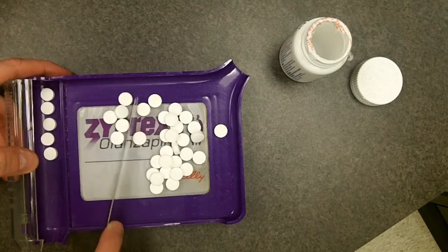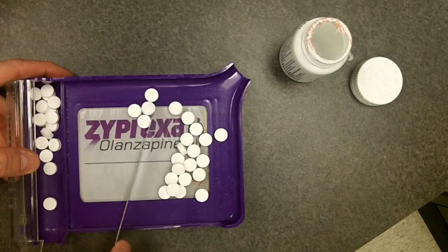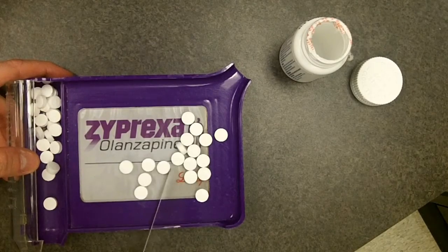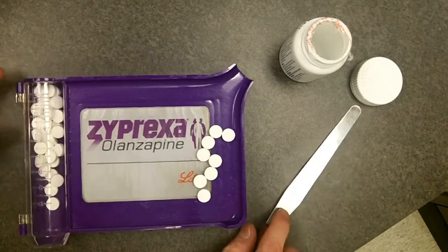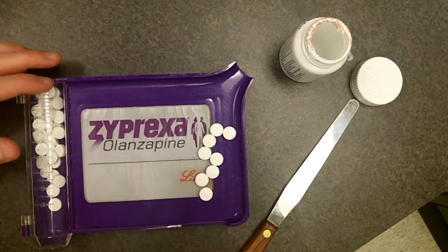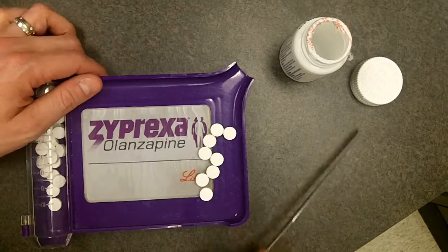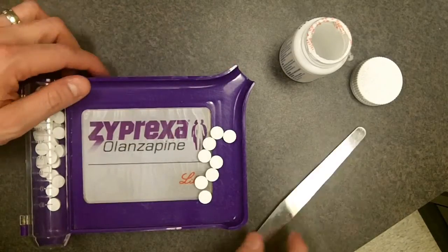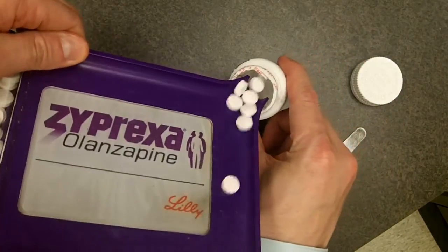Count by fives: 5, 10, 15, 20, 25, 30. Now you have 30 here in this compartment and some left over in the other side. There is a little opening right here and you can just pour those leftovers right back into your stock bottle.